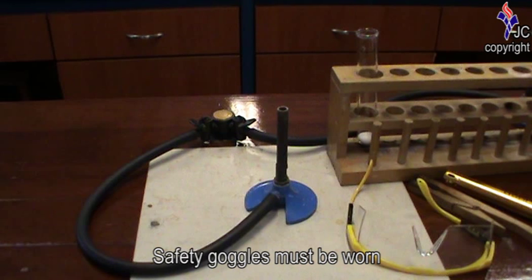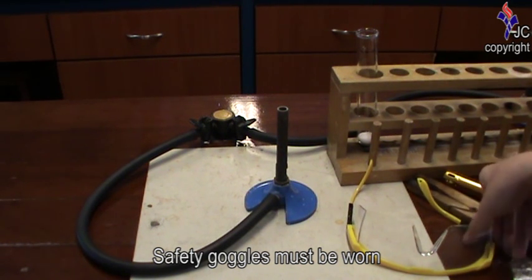Before any heating using the Bunsen burner is carried out, safety goggles must be worn.